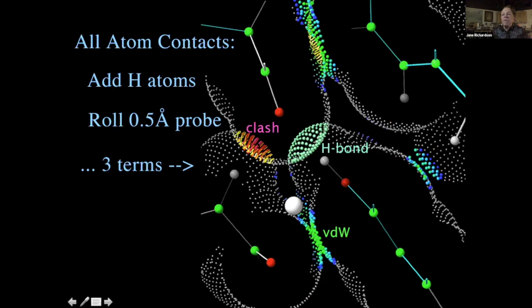And so the way we do that is that we put a ball of dots on each van der Waals surface of all the atoms, including the hydrogens. And then basically we roll a little ball. It's only 1/4 angstrom in radius. So we're looking at pretty tight contacts. And when it doesn't touch anything else, we don't do anything. But if it touches another non-covalently bonded atom, then we lay down a dot.